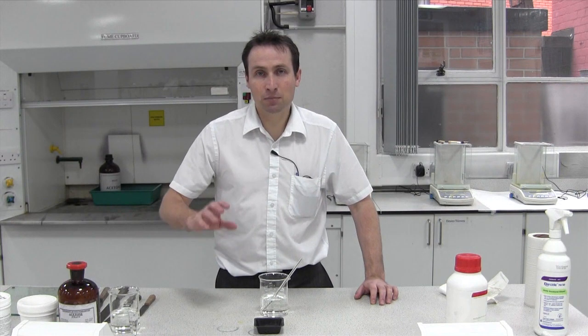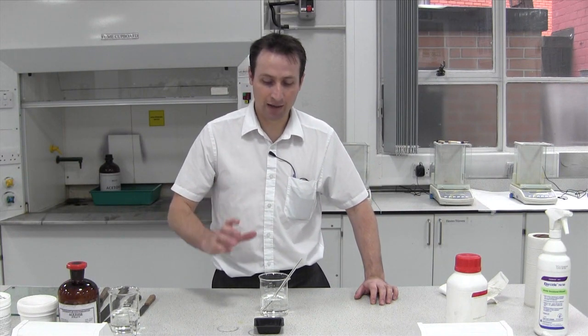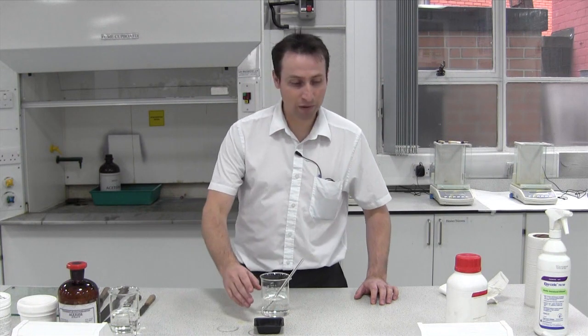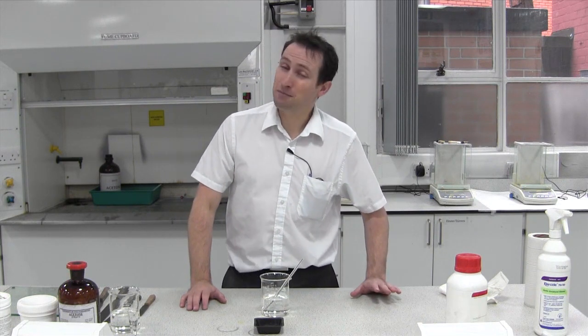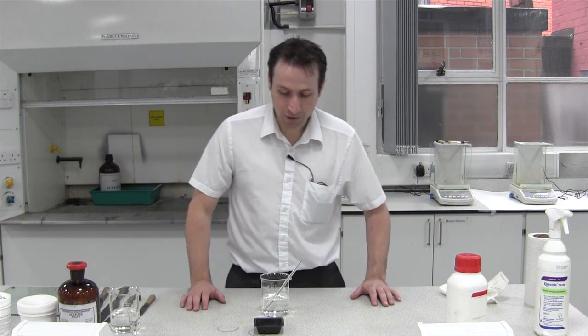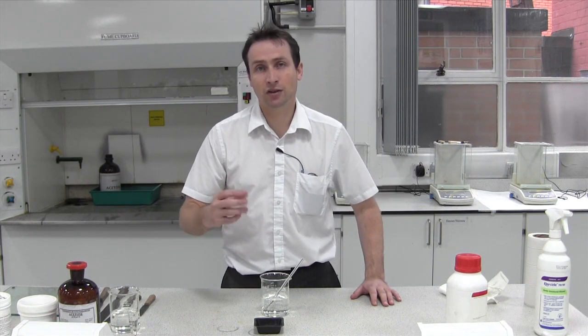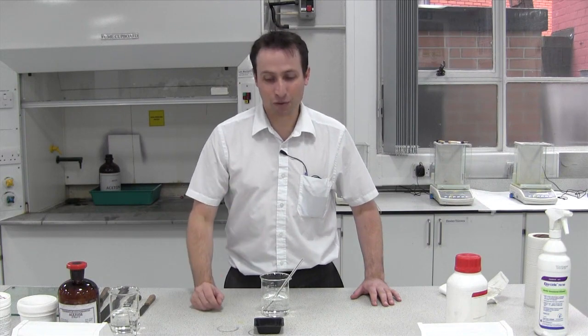Now we're going to look at making a solution using a powder — in this case, water. The powder we've got is glucose, or sugar. You'll probably be aware of how to make a cup of tea or coffee; it's much the same process. We're going to put the powder into the water and stir it. This powder is soluble in water, so it will go into solution.